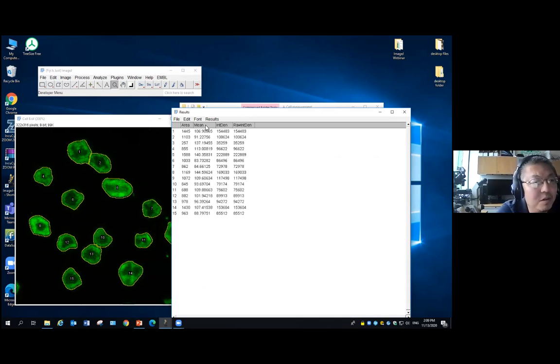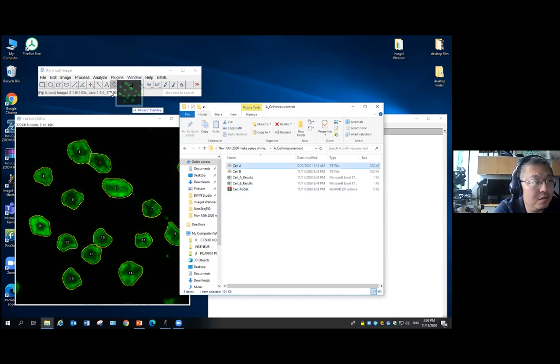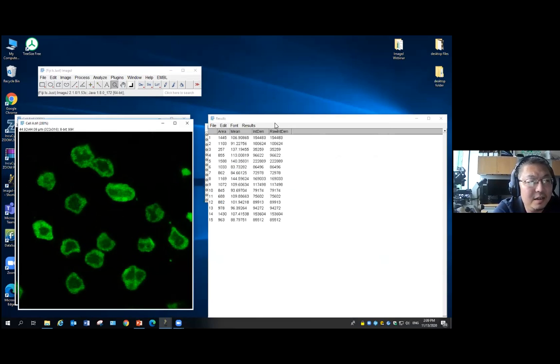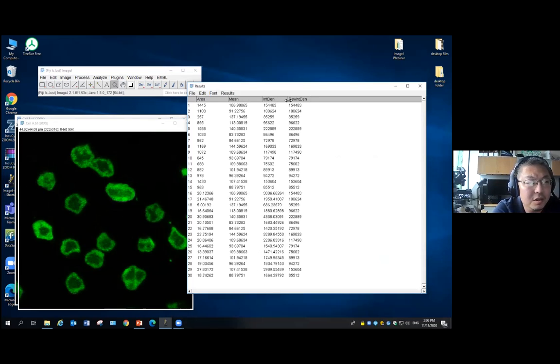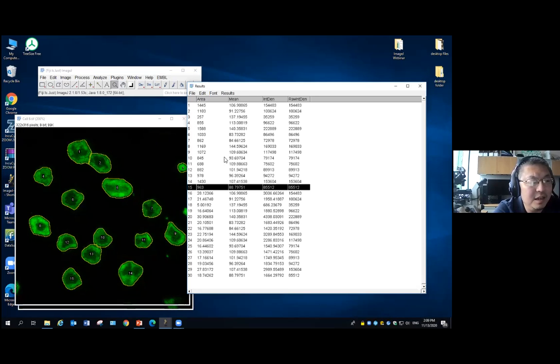Now you begin to see, if you still remember what this is in the results table, the mean intensity is still the same. It doesn't change, but actually the area changes. Okay? Actually, we can also open the cell A again, and I just measure it. It will add up to the list. So we have a total of 15 cells. The 1 to 15 is the cell B, and the 16 to 30 is cell A. As you can see, the mean intensity shows up basically the same, 106, 106 here. But the area changes.